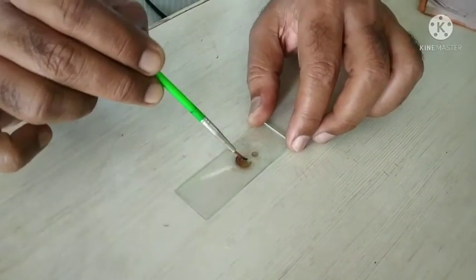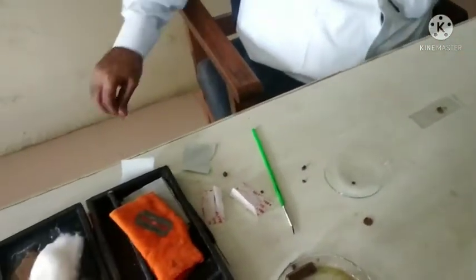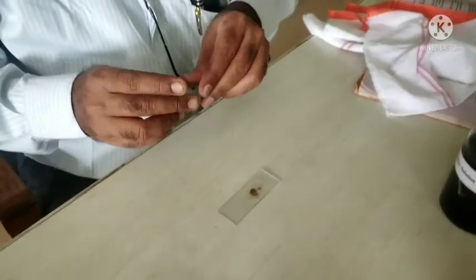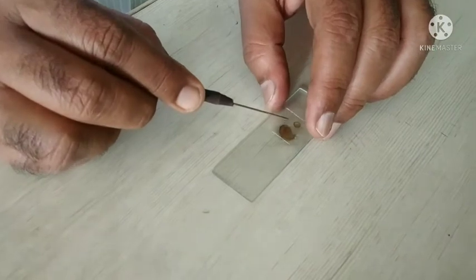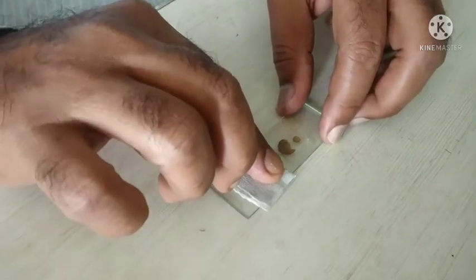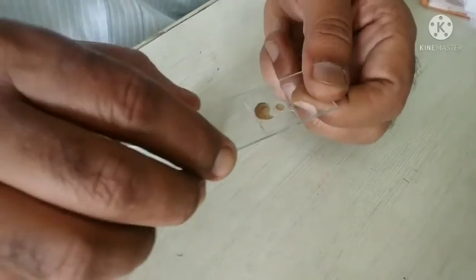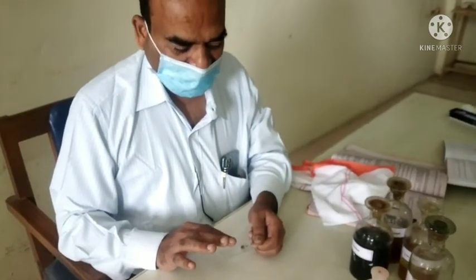Place a clean and dried cover slip on the section with the help of a dissecting needle. Clean the slide and remove the excessive fluid present on the slide with the help of blotting paper. After cleaning the slide, observe the slide under the microscope. It shows all the parts of the licorice root section.